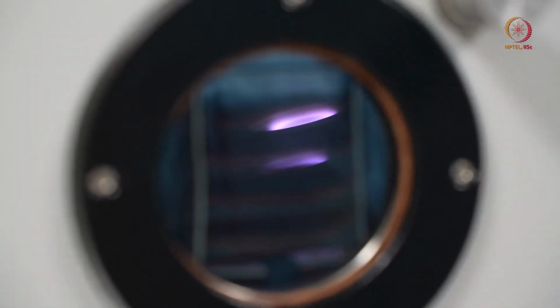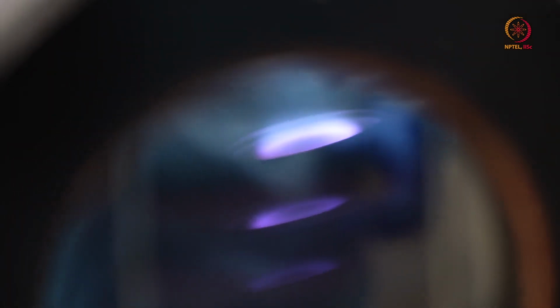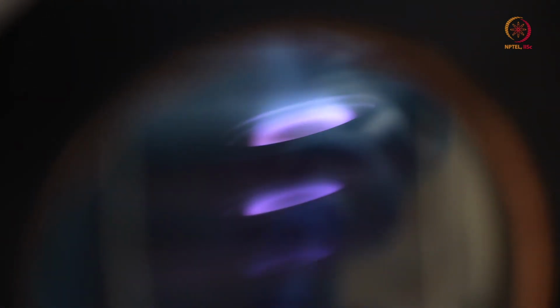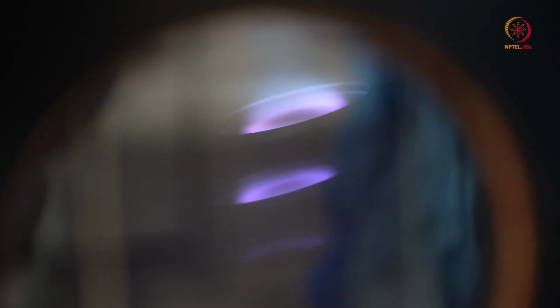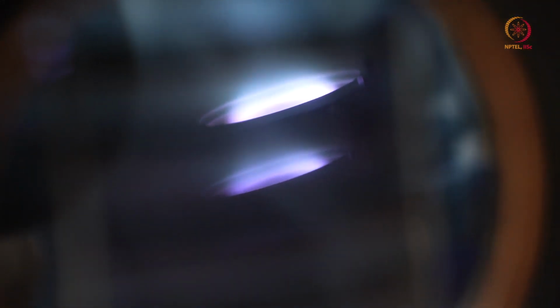So this is DC sputtering plasma. So here if you see now, when we show you that whole panel, that time you will understand. See, whatever the intensity was, this time I have increased that supply voltage. So with increment in supply voltage, obviously the plasma power that was there increased. So that means you can control either the supply voltage or the supply current or the maximum power. So any of these you can control, and you can control the power. So now I set it so that it will be around 150 watt.